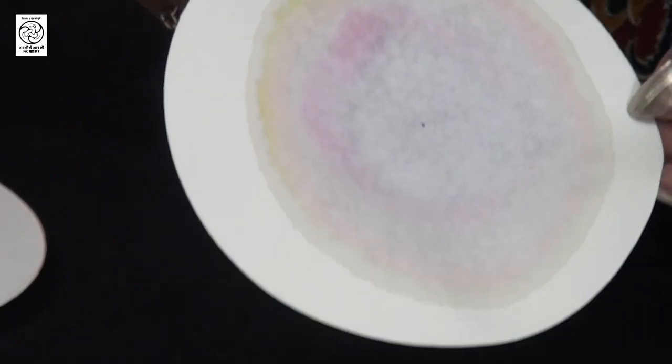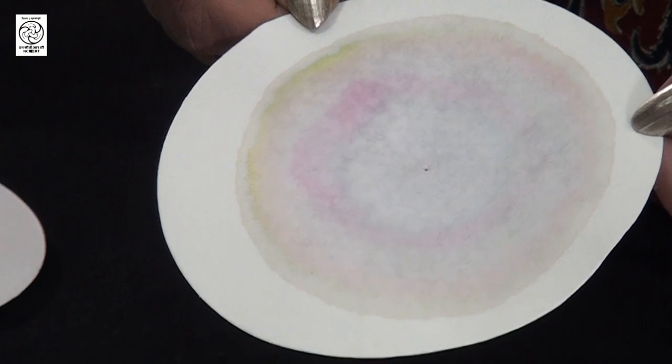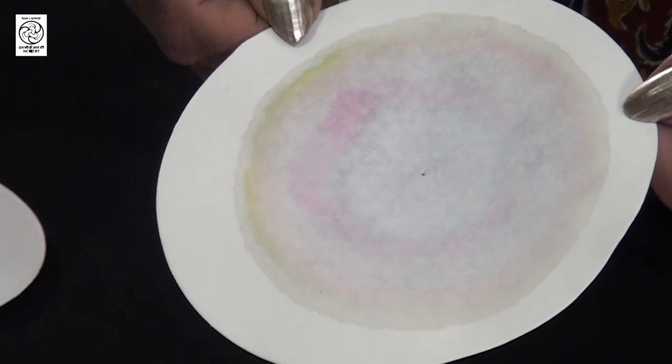We will let this filter paper dry and after drying the colours will be very clearly visible. Now can you tell me how did you find this experiment of paper chromatography? It was very simple! Yes, it was so simple — I thought it would be difficult but the colours separated so beautifully, it looks amazing. You can see that the separation has been very clear, the apparatus was very simple, almost no cost involved as compared to the kind of separations we are able to achieve. Very simple, very easy, very less time consuming — that was the purpose, to show you that by simple techniques also we can do wonders with chromatography.